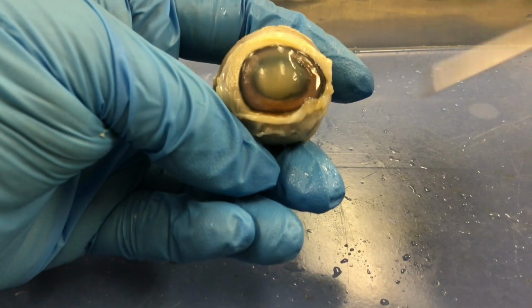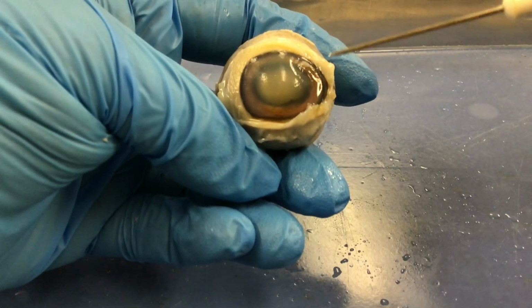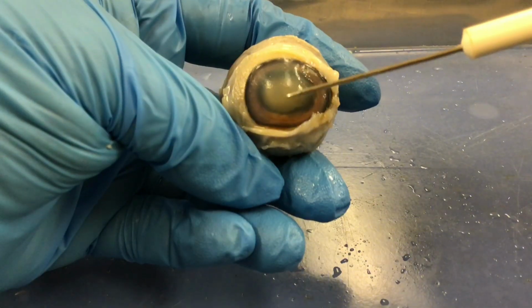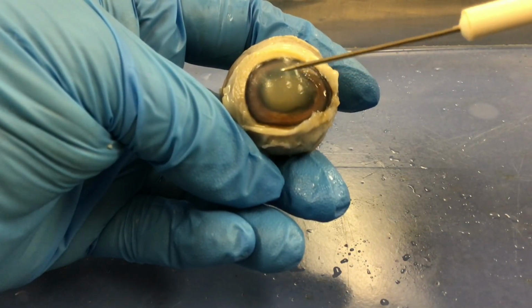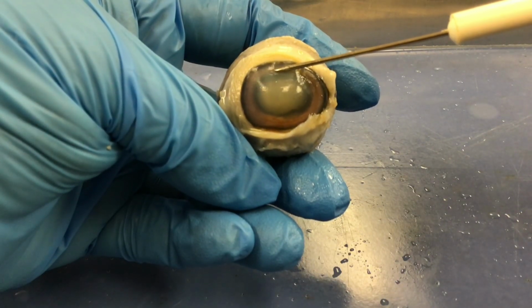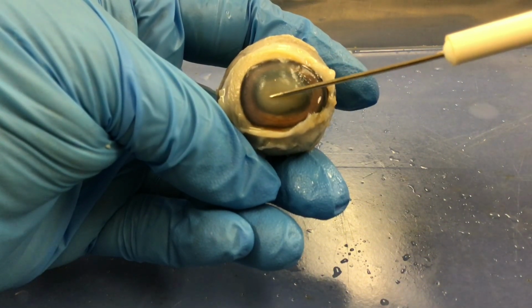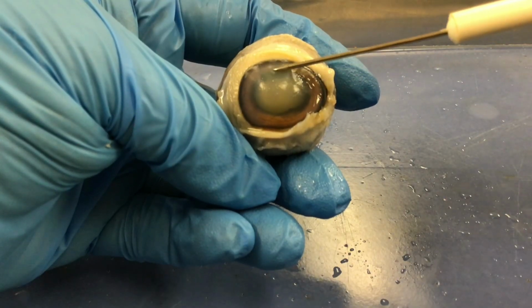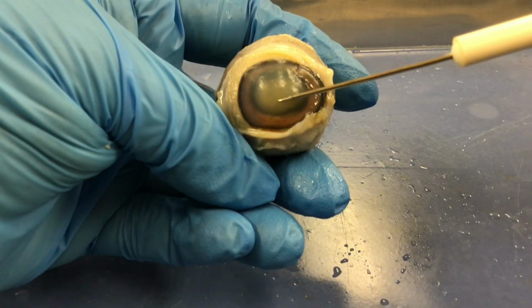And then actually behind the cornea, you can see this brownish structure. This is the iris of the eye, and the hole that would be between the iris is called the pupil. The iris is an intrinsic eye muscle, smooth muscle, meaning we do not have voluntary control over it. When it contracts, it will constrict the pupil, which will allow less light to pass through. When the iris relaxes, the pupil will dilate and allow more light to come through.